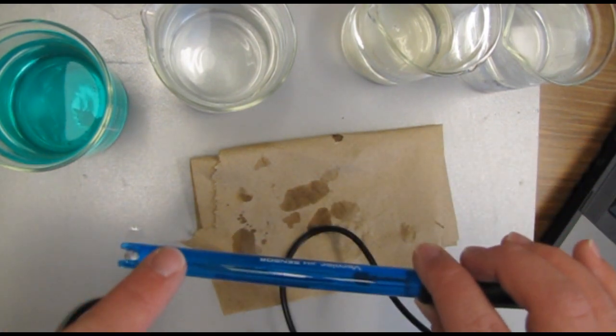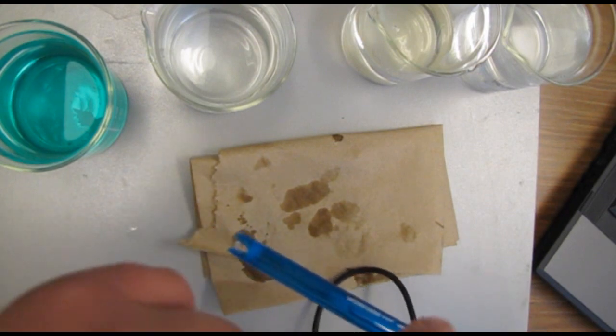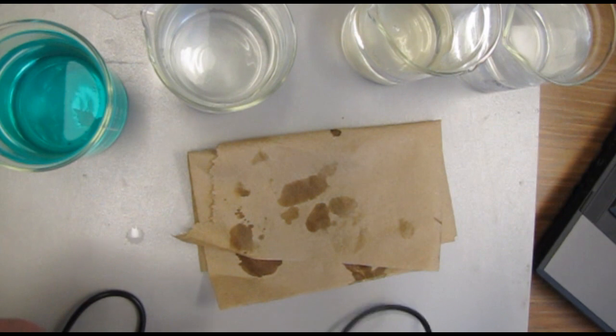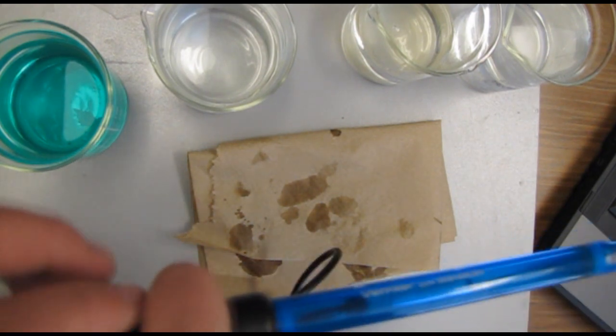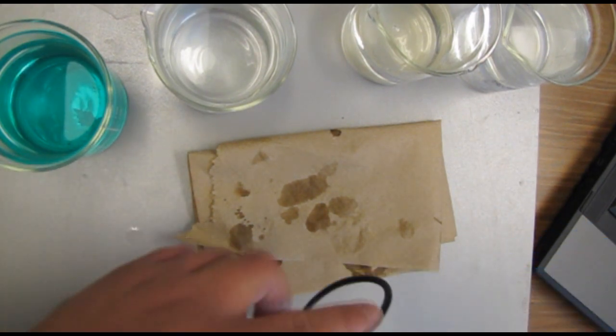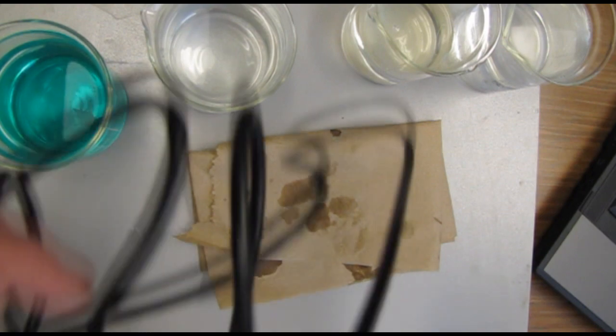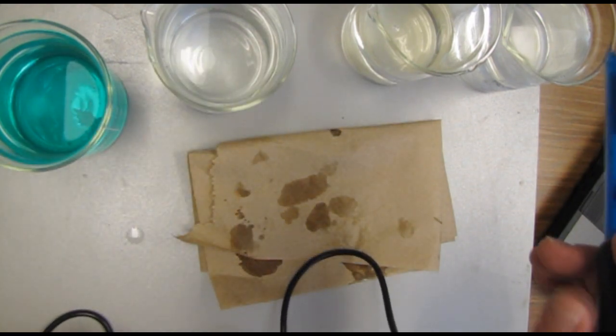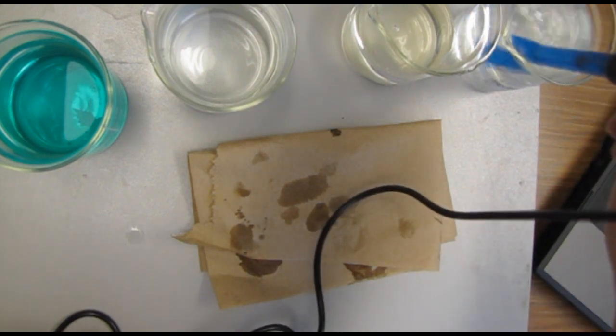Now keep in mind that only the blue part, as I just showed you, can touch any liquid. None of the black areas of the probe or the wires can touch any liquid. Also keep in mind that you don't have to fully submerge it.